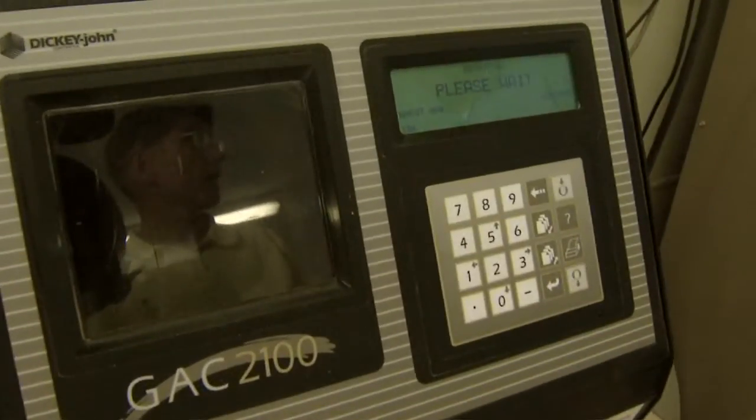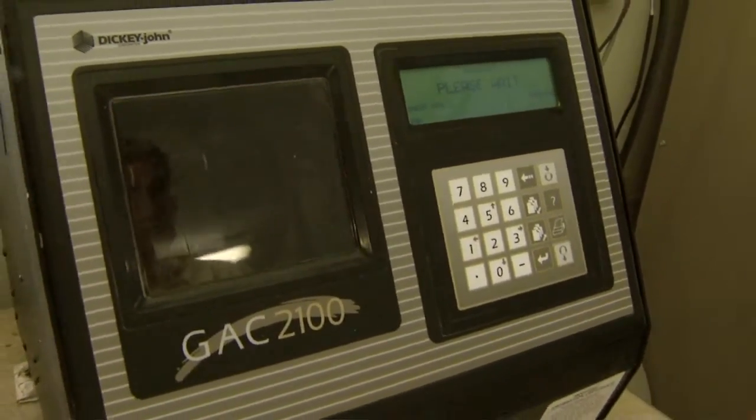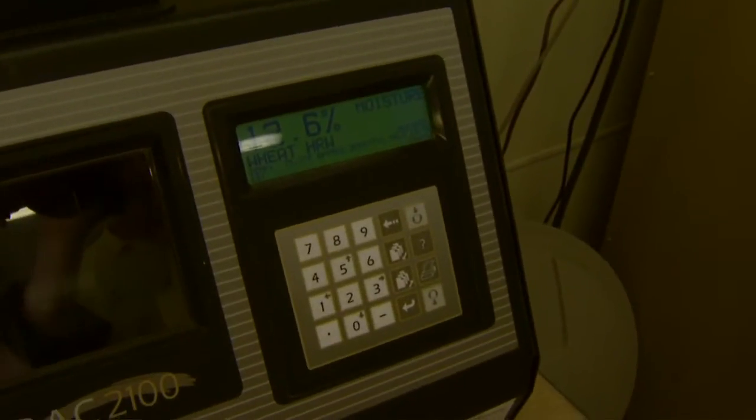Because the trash and everything has moisture, and if you've got too high moisture even in the dockage, then it's going to go out of condition. On moisture, you really want it down to 11.5% or less. If you start getting it in at 12% in the morning, by the evening it's going to average out to somewhere around 11.5%. This sample is reading 12.6% — it's going in a little wet and you probably want to ship it pretty quick.